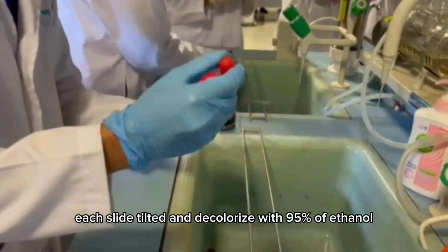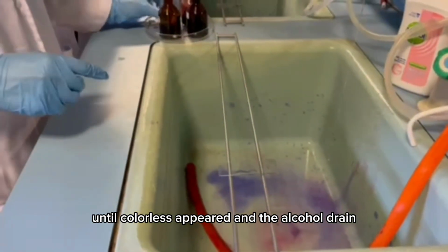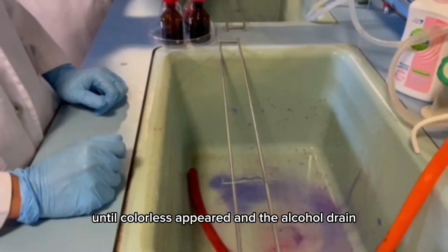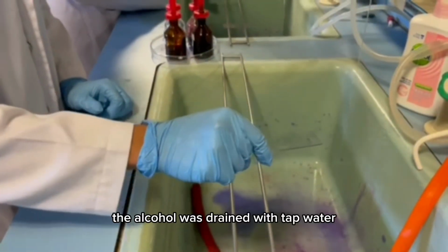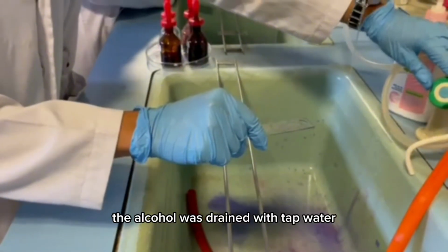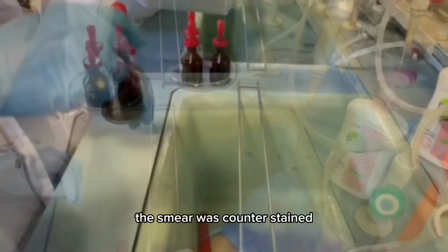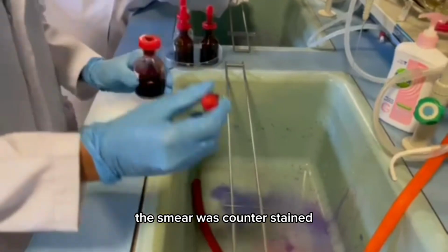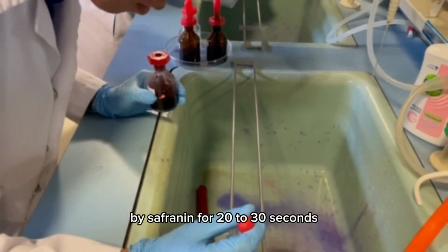Each slide was tilted and decolorized with 95% ethanol until colorless, and the alcohol was drained after 15 seconds. The alcohol was washed off with tap water. The smear was counterstained with safranin for 20 to 30 seconds.